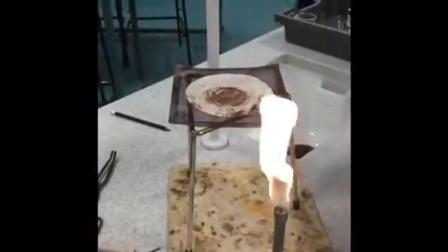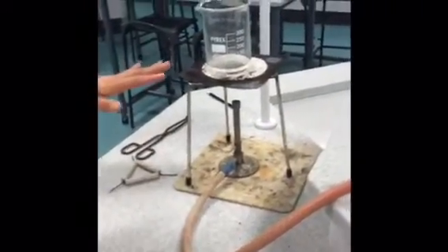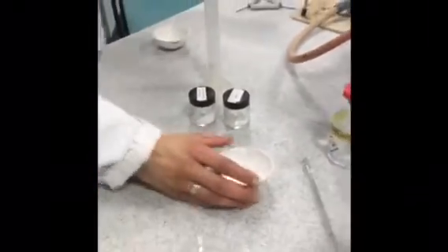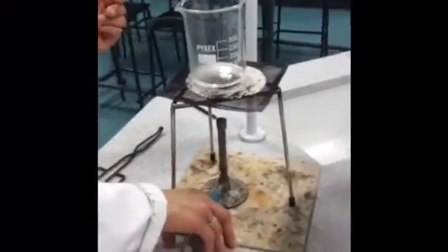We now have a sample of salt crystals but these are impure, so what we need to do is purify these further. To do this, take about 20 ml of distilled water and warm that up gently using the Bunsen burner — we're warming up the water in order to purify our salt crystals further, for about 30 seconds to a minute.